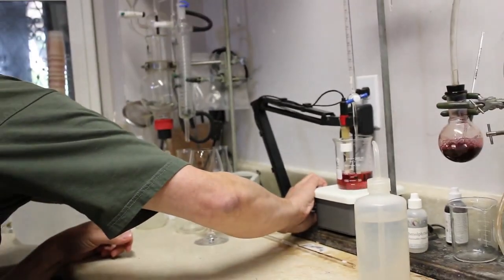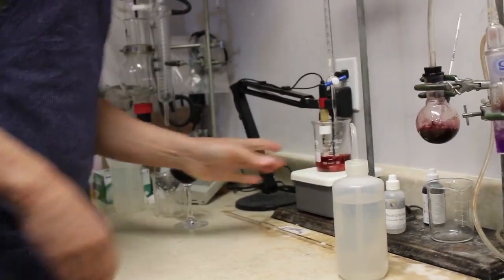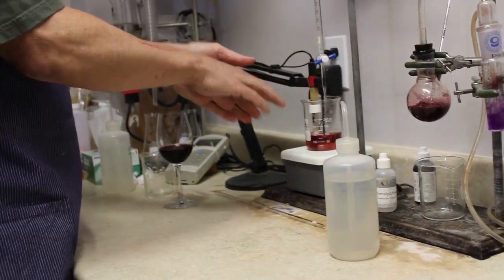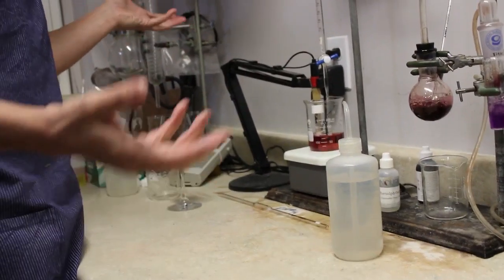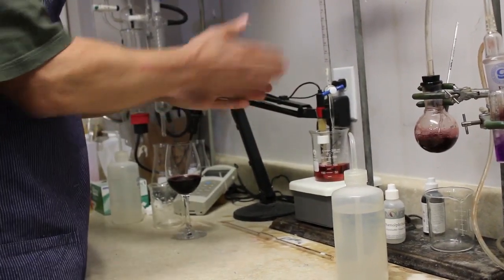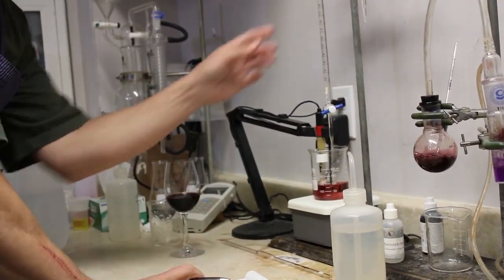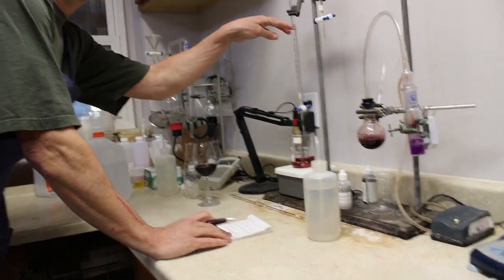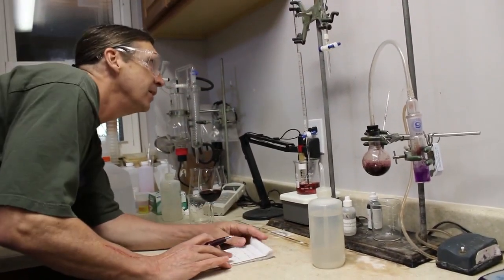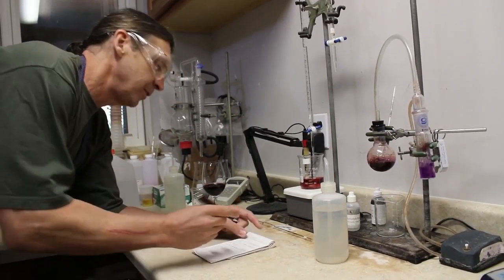And of course, everything has to be set just right. So right now, I'm showing a 3.4 pH, so that's the acid that went into the water. Now I will start titrating, so the first thing I do is I record my start point of sodium hydroxide, and remember this is a 0.1 normal. You don't have to know what that means, but it is significant. So I'm starting at 13.2.